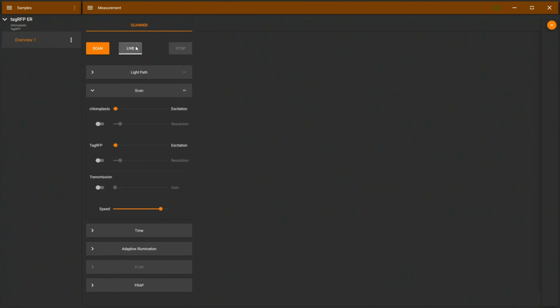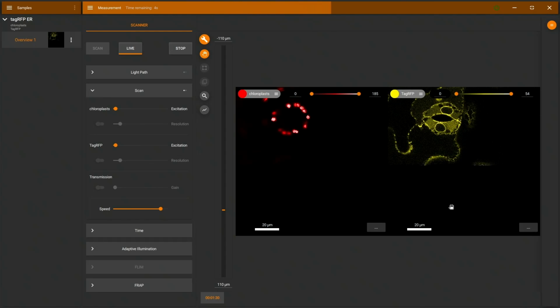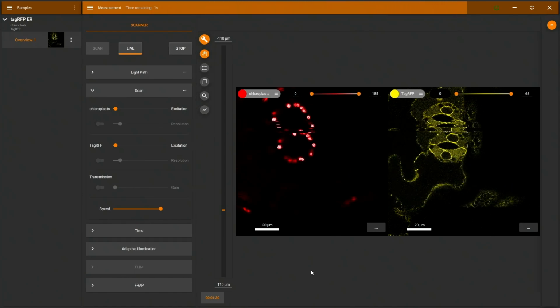And I'll start directly with a live image. You can see here the ER structures and the stoma. I can now again use my mouse to move the stage, move everything into the center.